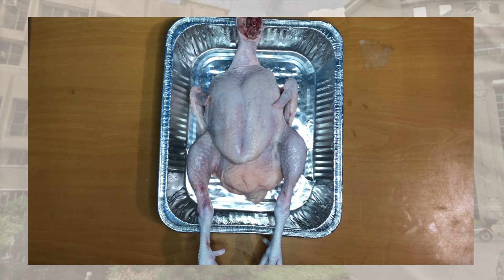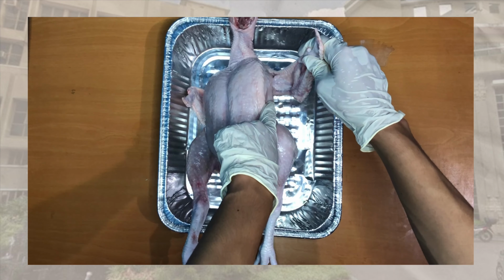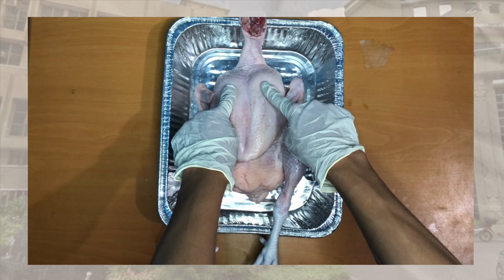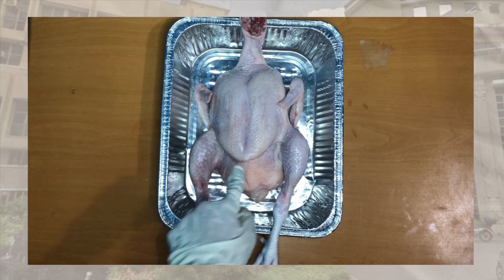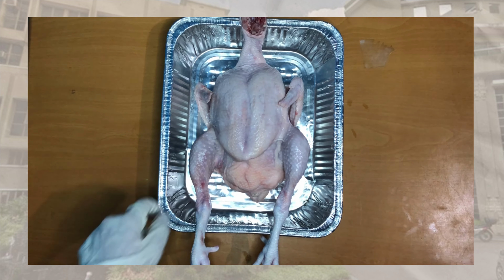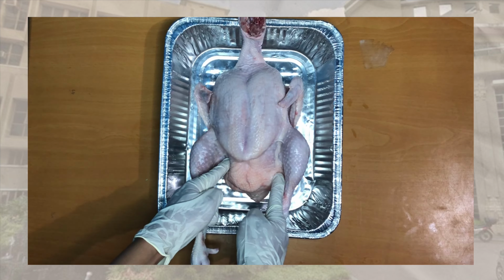Under the thoracic area are sternal, axillary, and pectoral. In the abdominal area, here is the umbilical. Under pelvic is inguinal, also known as the groin.